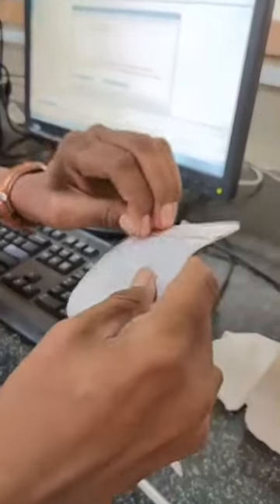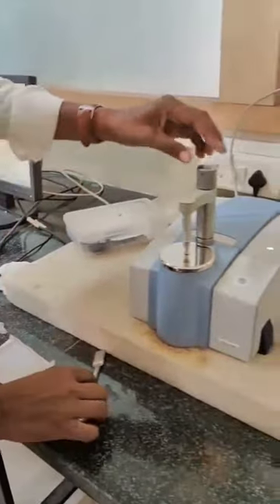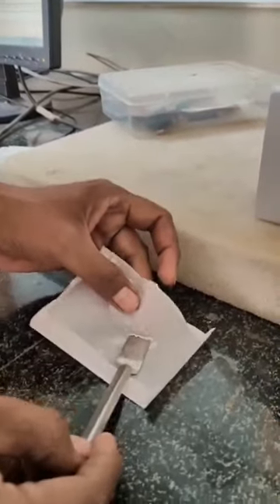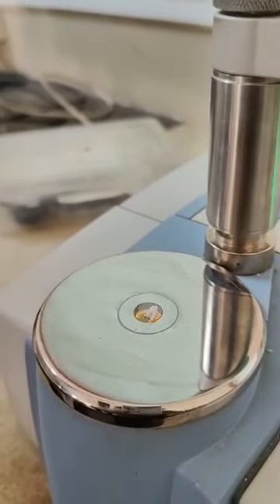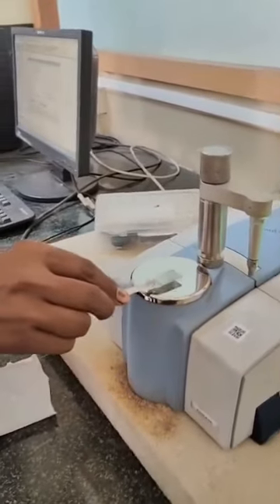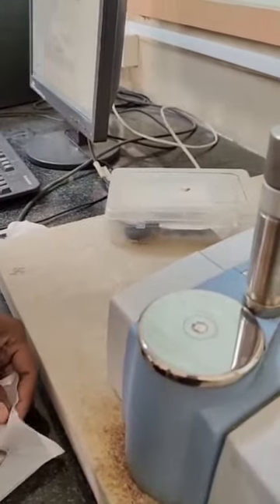Here you can see this sample — I got it from a PhD student's research work. I have taken the sample from the sample tube. Before starting the sample analysis, we have to move this knob to the correct position and place the sample on the crystal.